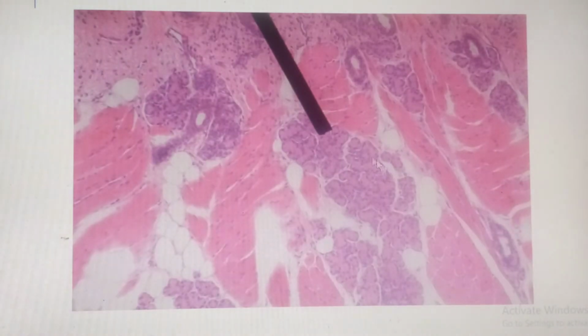So there we are. As I was showing you, you can see that these are deeply stained glands found in skeletal muscle fibers running in different directions. Very important, running in different directions. That is the characteristic feature that you find over here. Now, this one specifically was taken in the vicinity of what we call the circumvallate papillae, okay? And these glands are known as von Ebner's glands.